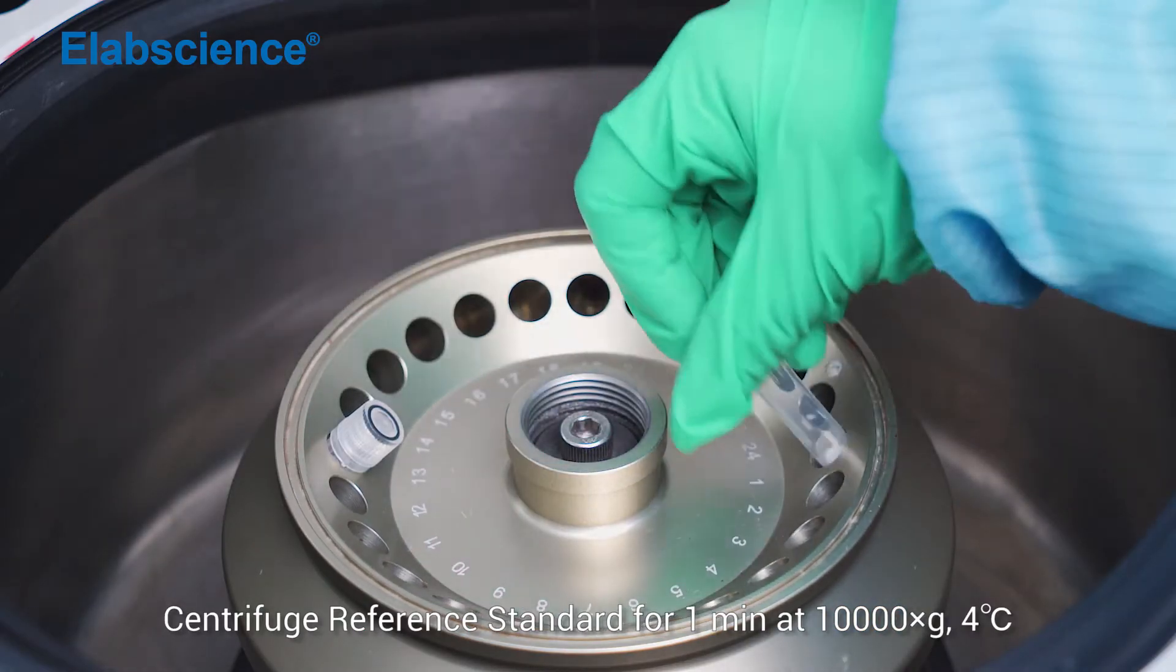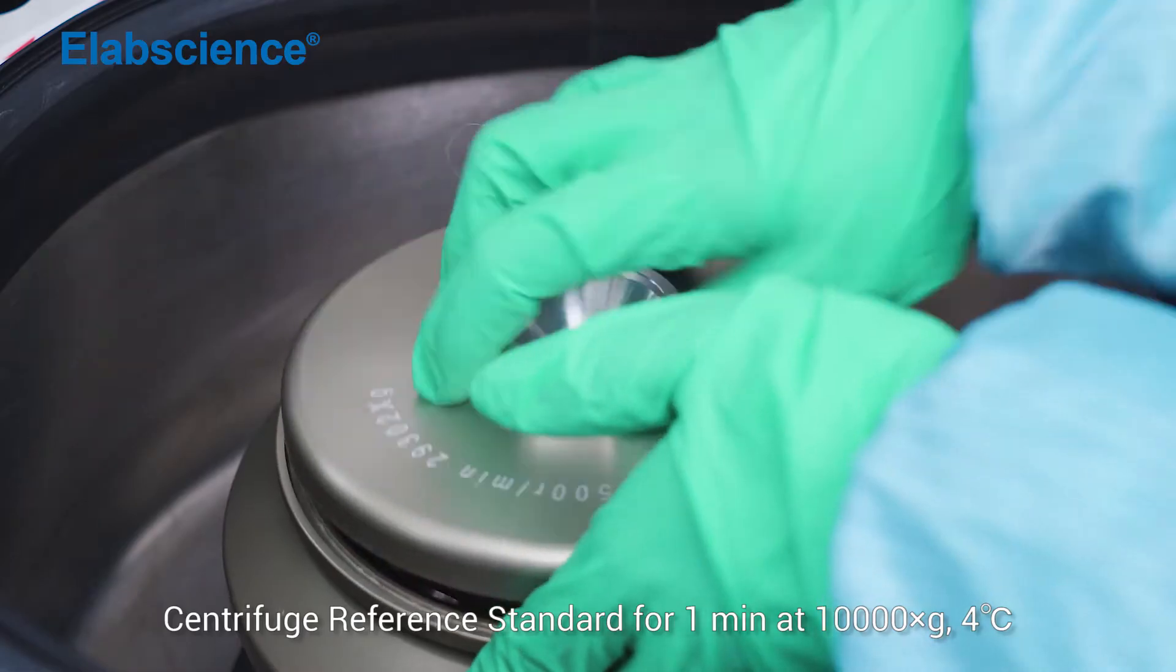Centrifuge reference standard for 1 minute at 10,000 times gravity at 4 degrees.